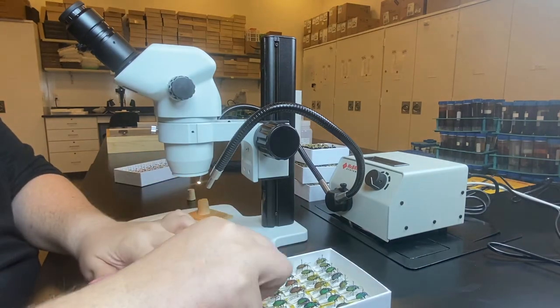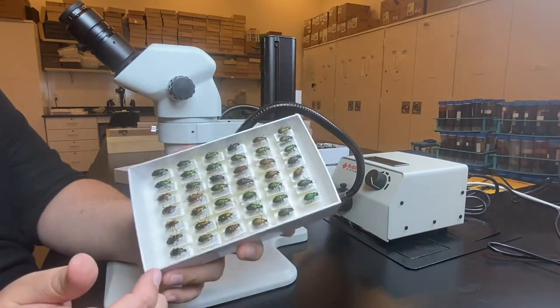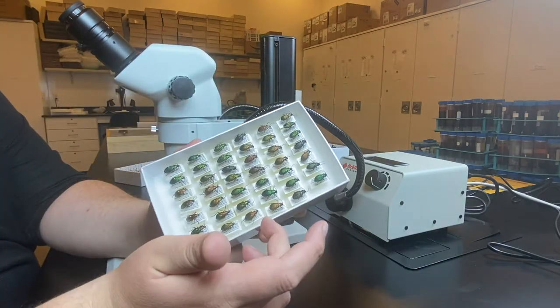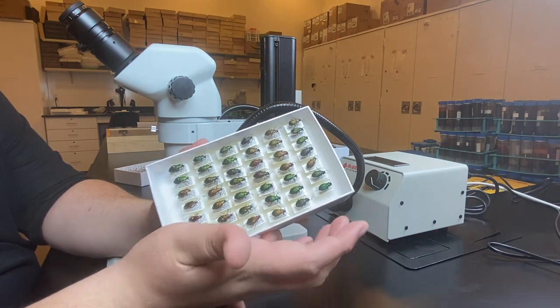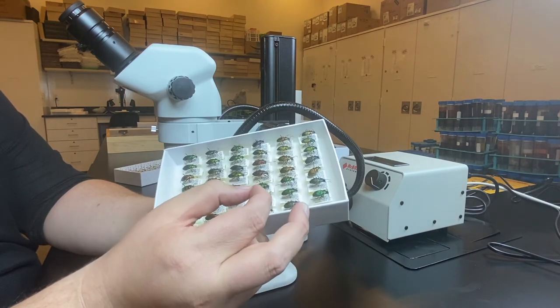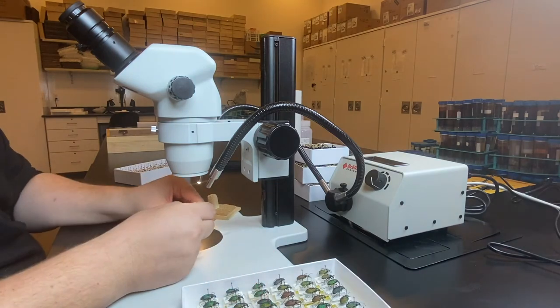When we're ready to examine a specimen, we'll take the unit tray and hold it firmly, often with your arm resting on the table. Your other hand may also be on the table, but the hand you'll draw from — you usually want to put a finger or the side of your palm against the unit tray to brace it, and then go in with two fingers to actually select your specimen and carefully remove it from your box or from your series of specimens.